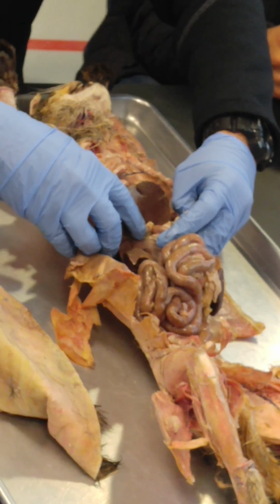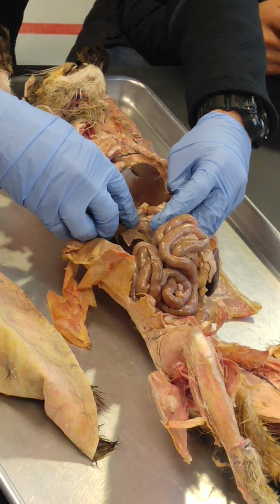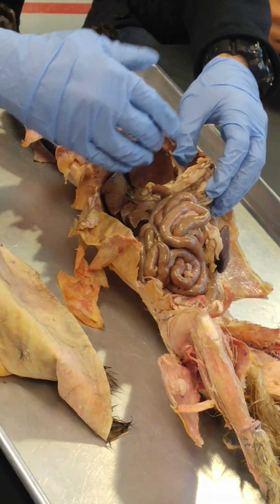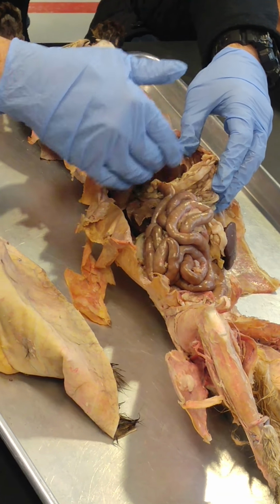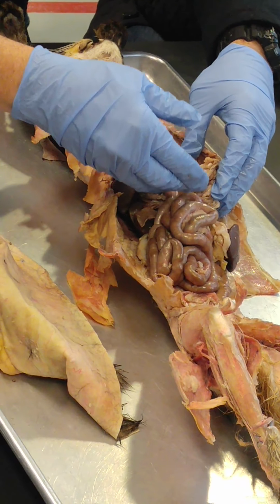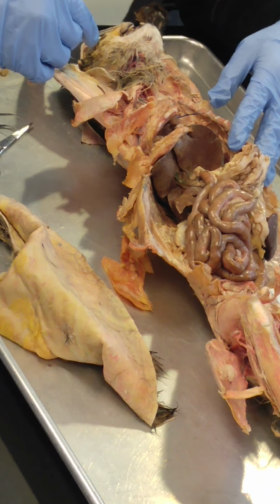The reason we won't have you know it on the cat is because when we start getting in here, we'll destroy some of the vessels, and that includes the hepatic portal vein that you're already familiar with. Remember, the hepatic portal vein goes from the intestines up to the liver to drain digested material coming from the small intestines into the liver to be processed.